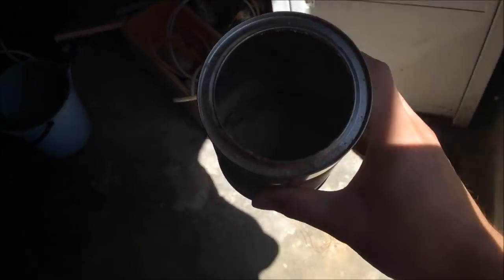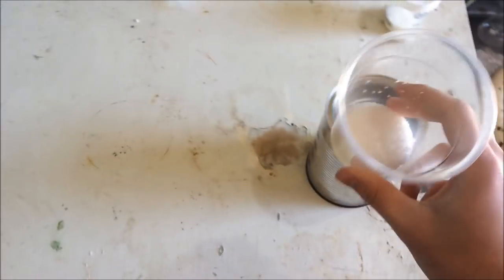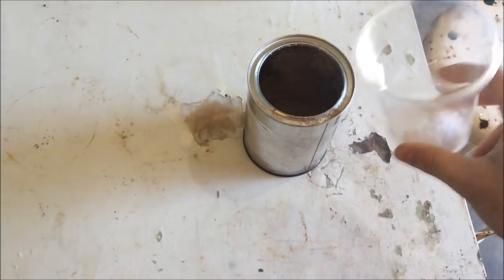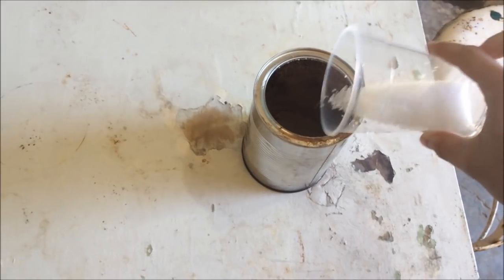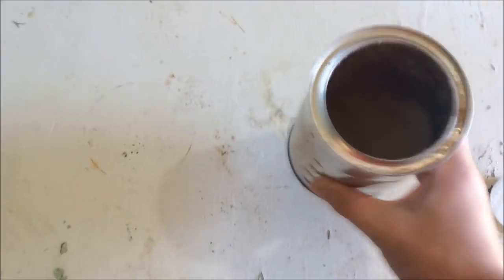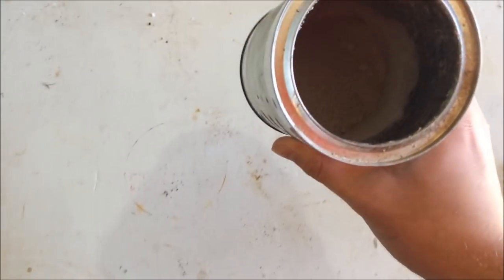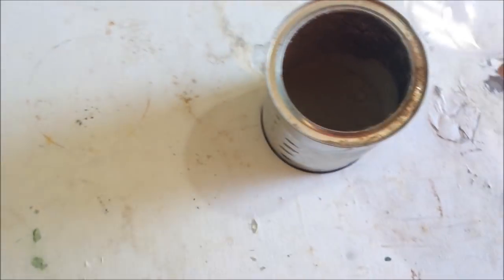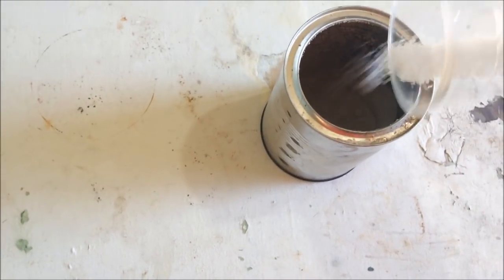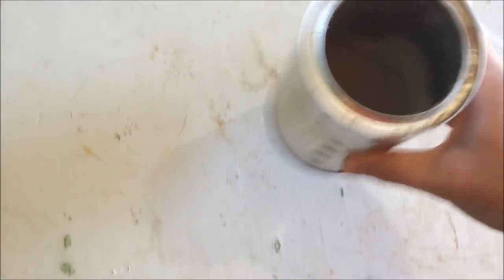It used to be nice, but anyway, we're not going to crush up the sodium hydroxide because it's slightly wet, so it'd be very annoying to grind. And I'm hoping it all just melts anyway. So as long as the sodium terephthalate is fine, it can just coat around the outsides of those prills. Yep, that's what it's doing. And then as the sodium hydroxide melts, it'll have great contact with the terephthalate to do the decarboxylation.